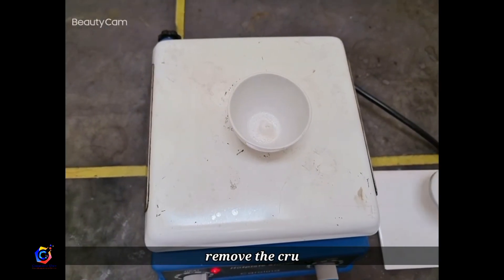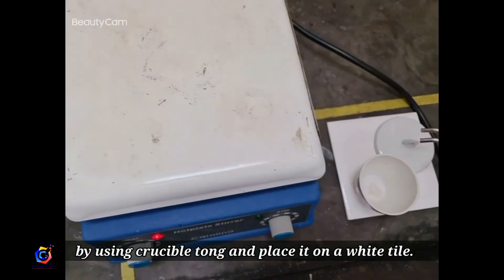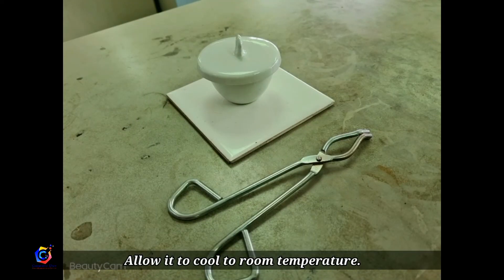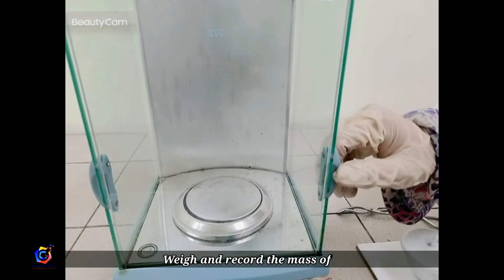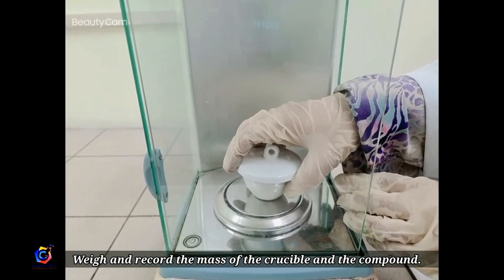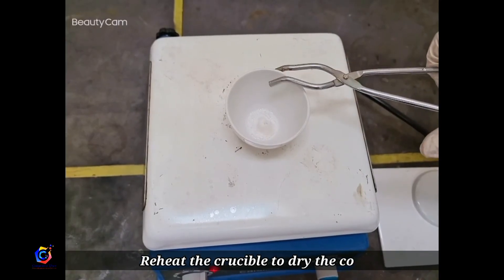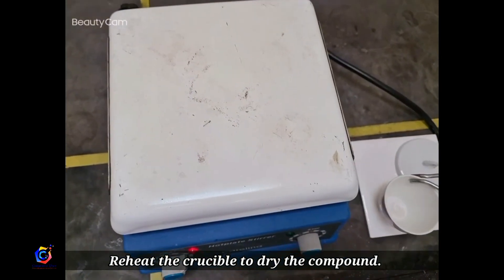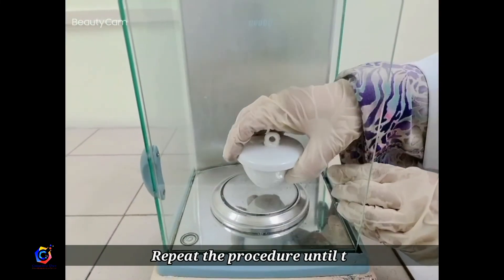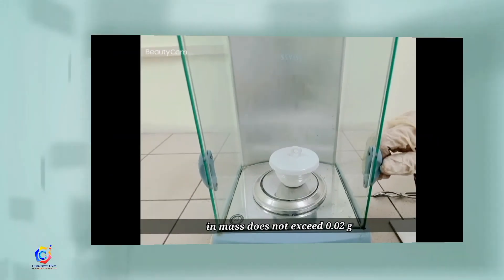When the compound is completely dry, remove the crucible from the hot plate immediately using crucible tongs and place it on a white tile. Allow it to cool to room temperature. Weigh and record the mass of the crucible and the compound. Repeat the reheat and weighing procedure until the difference in mass does not exceed 0.02 g.